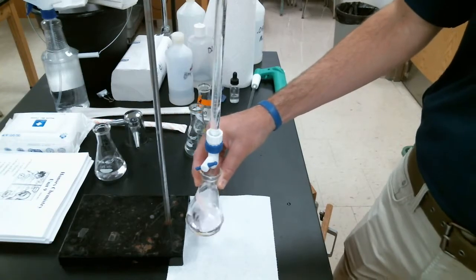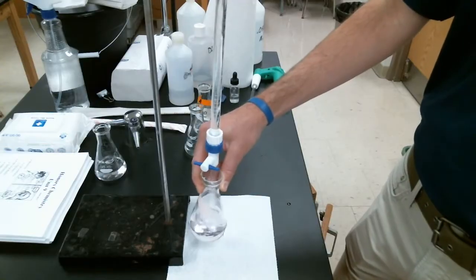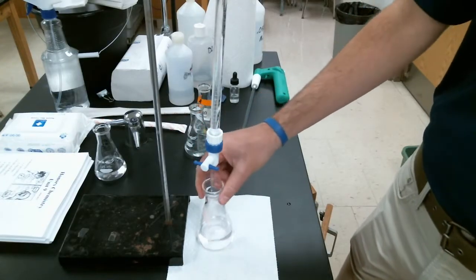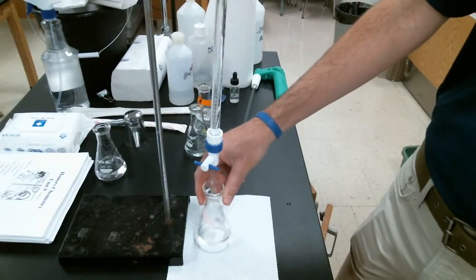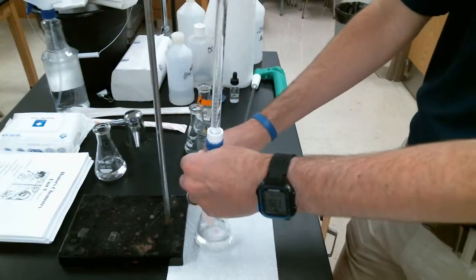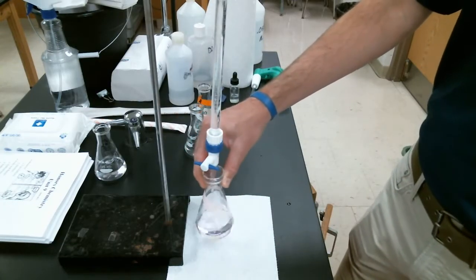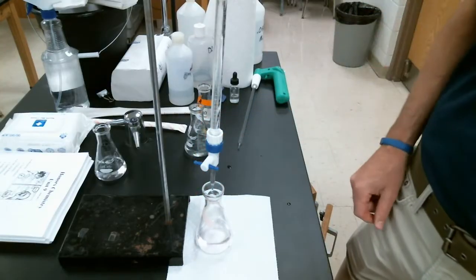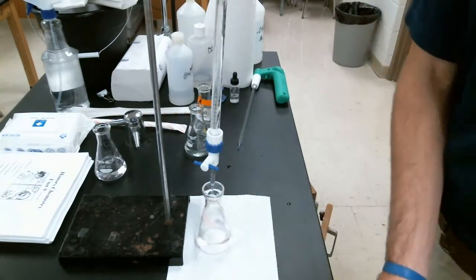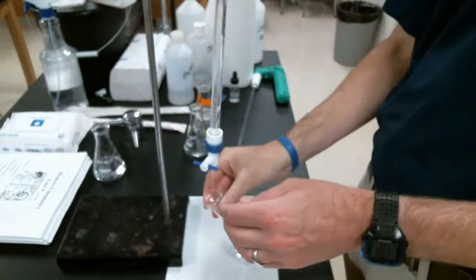Okay, we're getting pretty close there. It's kind of hard to see. Did that stay? Oh, it got so close. A couple drops. Oh, look at that light pink color. Okay, it looks like that might be staying. I'm swirling it. Again, it might be hard to see from this angle. Let's see if I hold it up with a piece of white paper, if it looks a little more clear. Okay, that is more clear. That light pink color is not really staying.